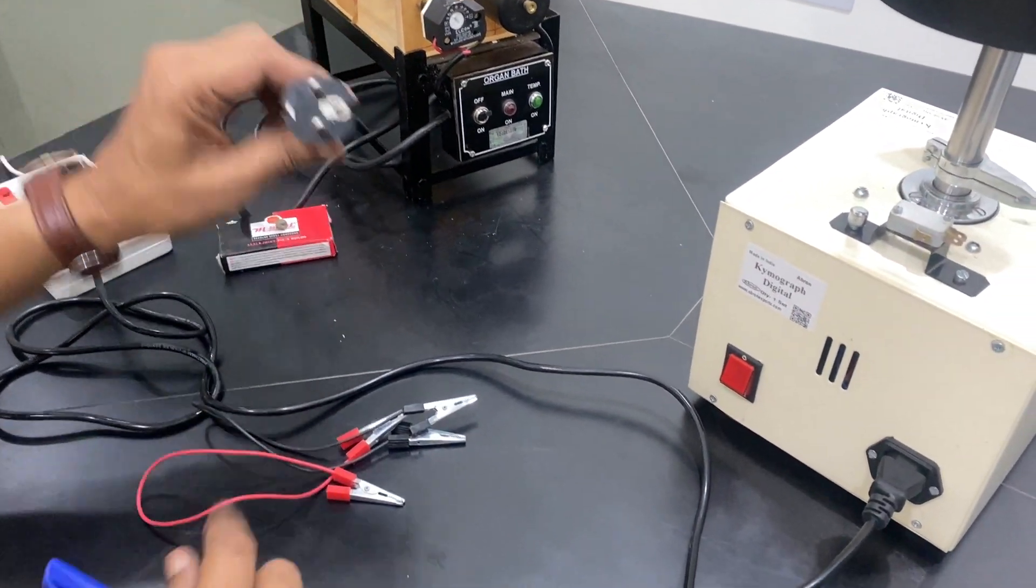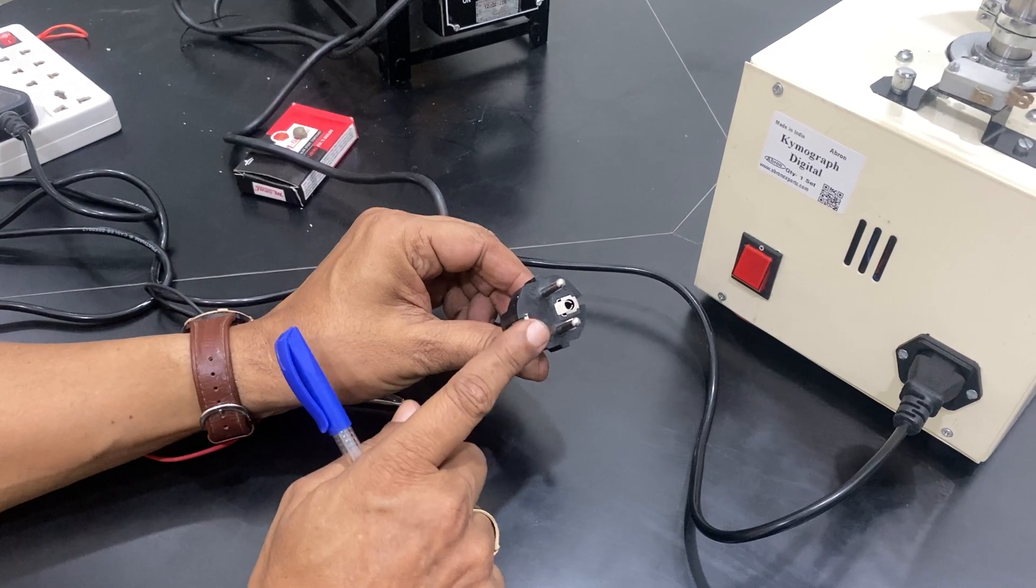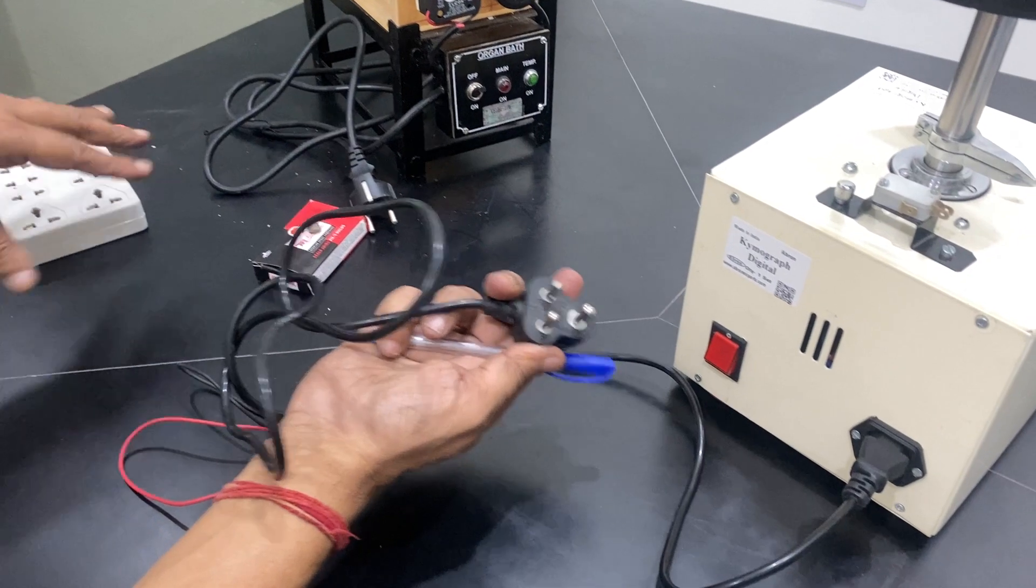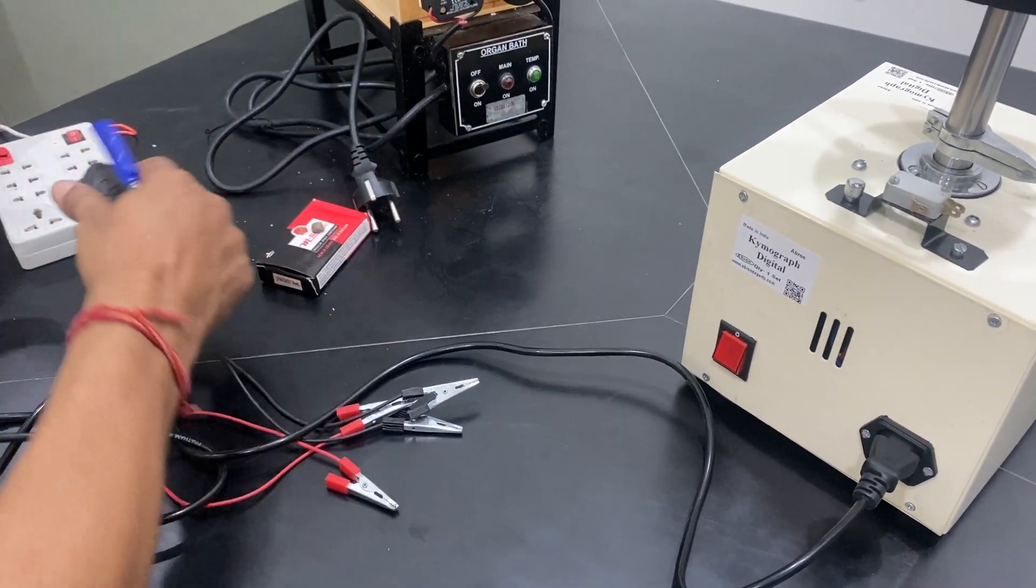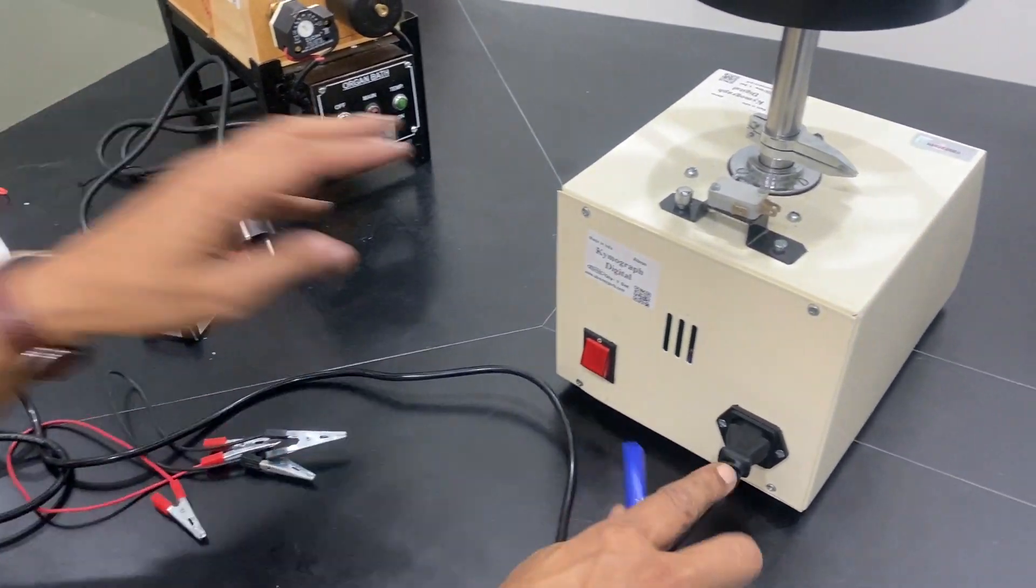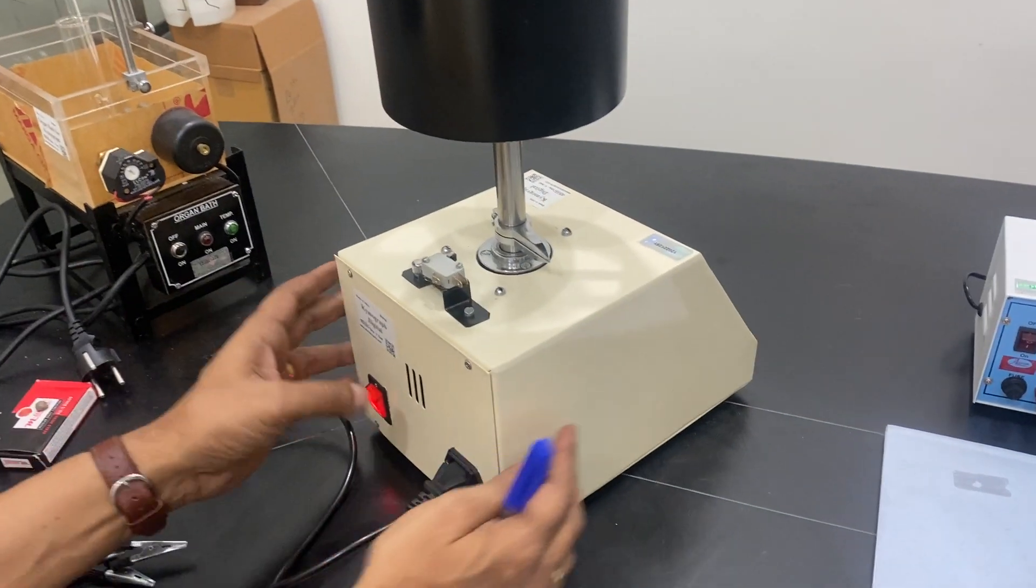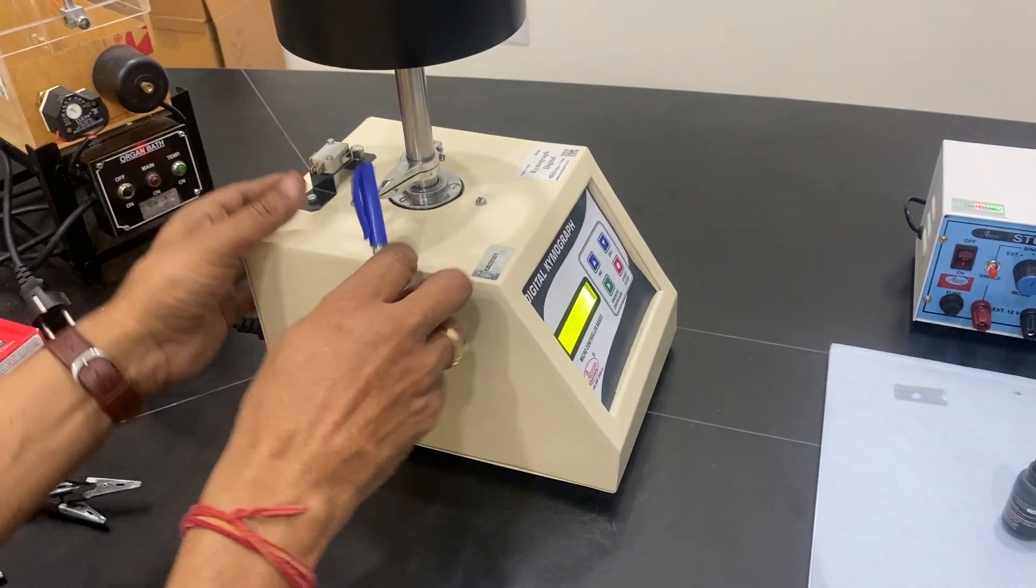We have got this clamp wire. We are providing Europe type and Indian type also. We will be sending as per your requirement. We are attaching it, then we connect it to the 220 volt and switch on the kymograph.